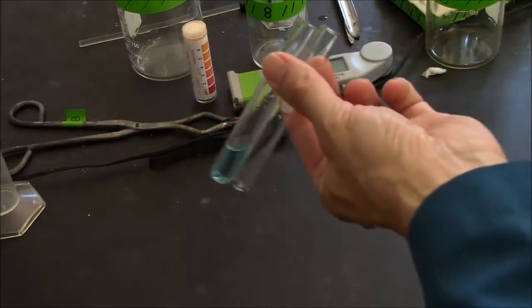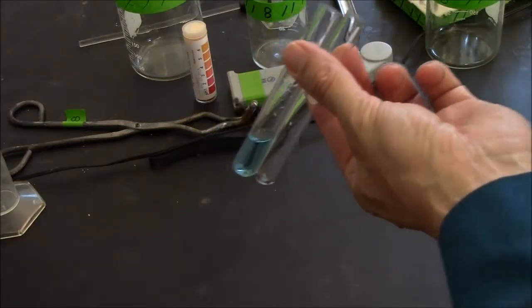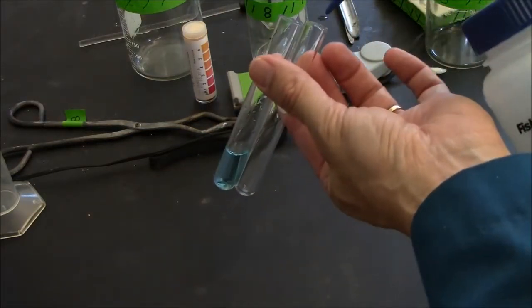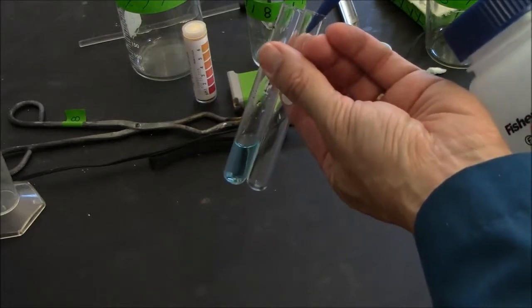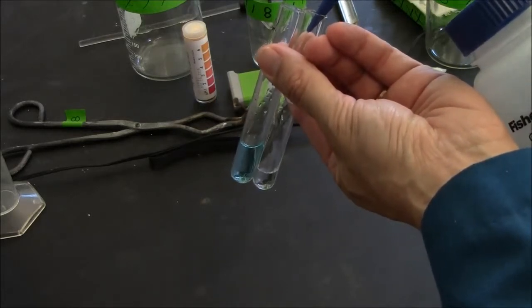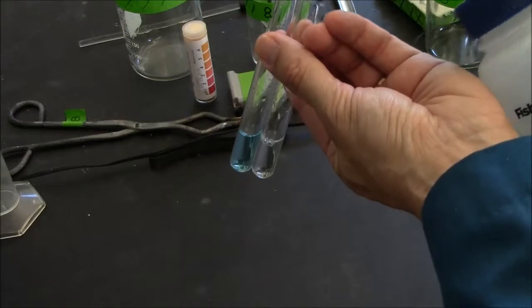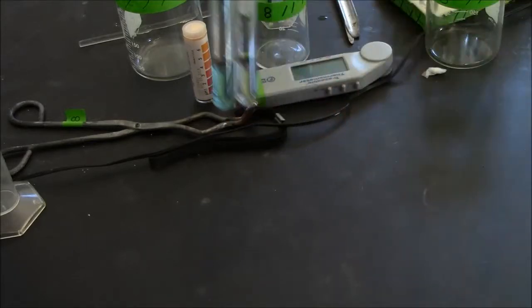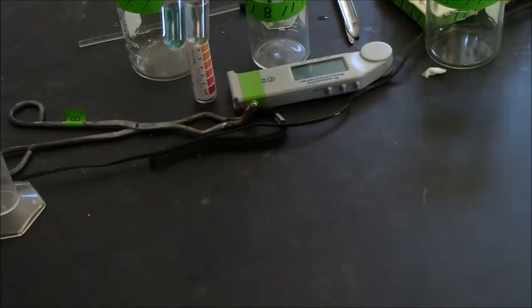To create balanced tubes, I will add some water until these look identical. These tubes will be balanced.